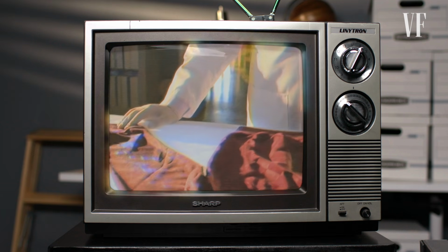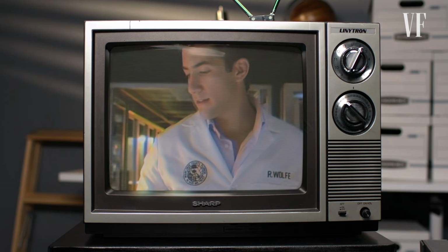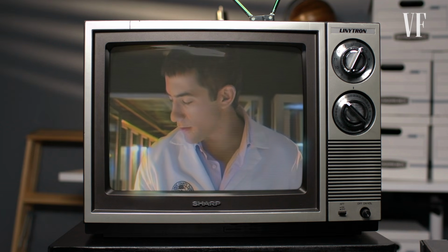No! No! The more you spray a liquid like that onto a surface, the more you're going to dilute the stain. That can make it extremely difficult for the DNA analyst to extract the white blood cells that are needed for a DNA analysis. So the fact that he's spraying this luminol on the sleeve over and over and over again, he's diluting that sample.